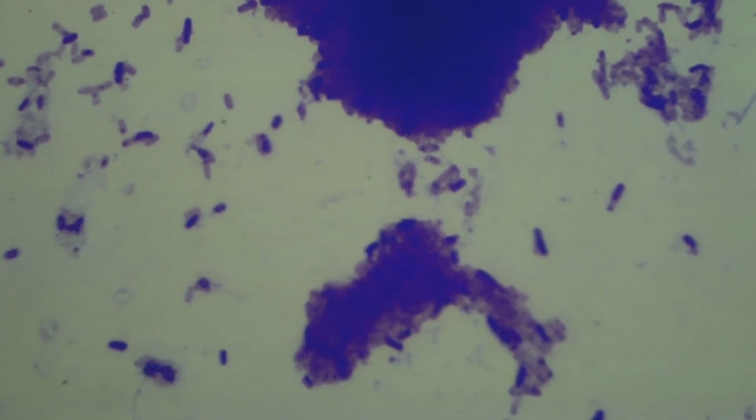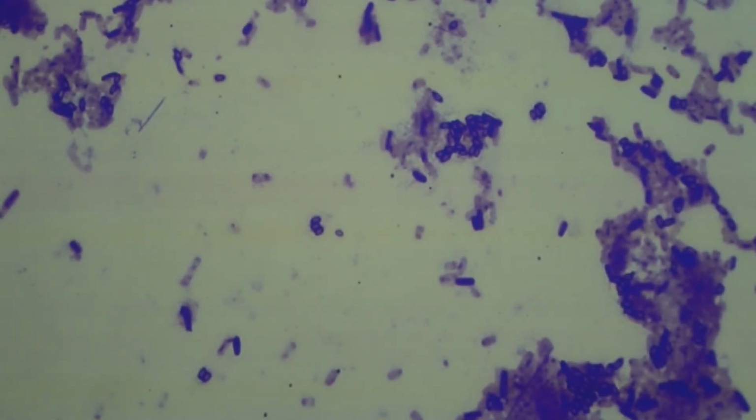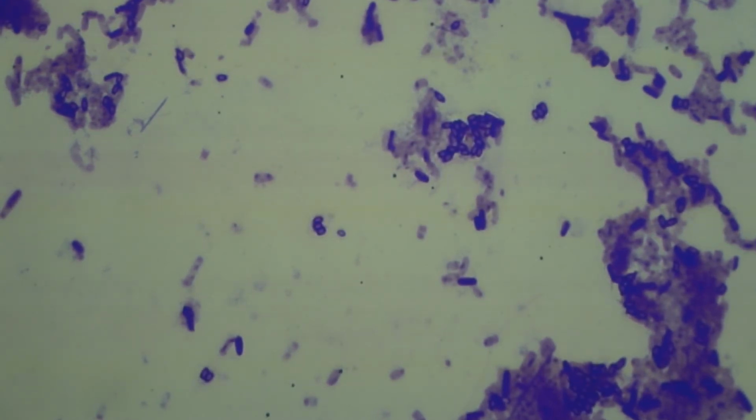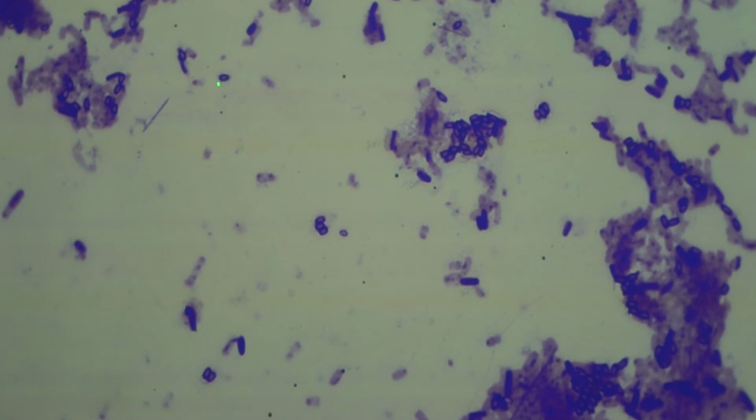So this is a mixed culture. This culture was getting old. In its major growth stage, all you see are dark, long, thick rods. But as it uses up all of its nutrients and begins to suffer from the diminished nutrient availability and the increased waste, then it sporulates and it forms these egg-shaped structures that do not stain all the way through. So here's a cluster of spores. Okay, so that's Bacillus subtilis.